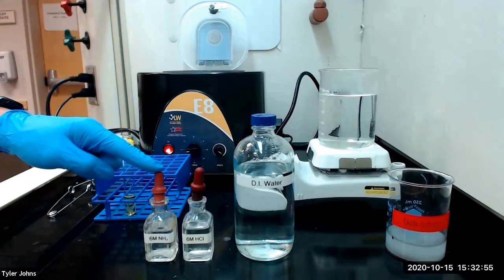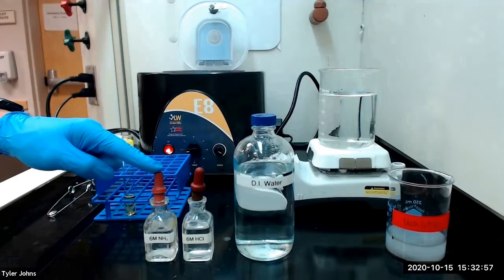We will then make the solution just basic with the addition of six molar ammonia.